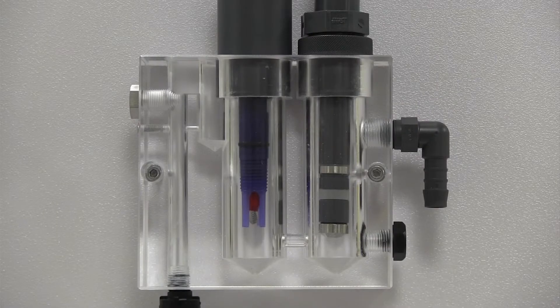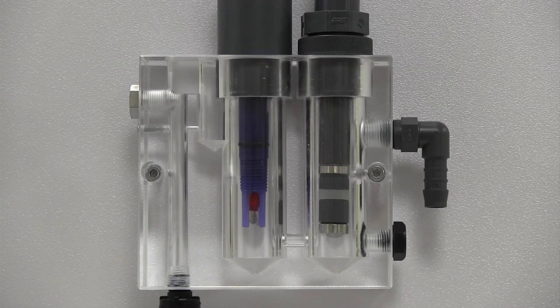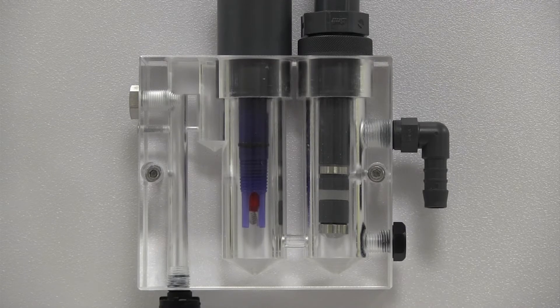For the dual flow cell, the chlorine probe should only be used in the second flow chamber, the chamber on the right.